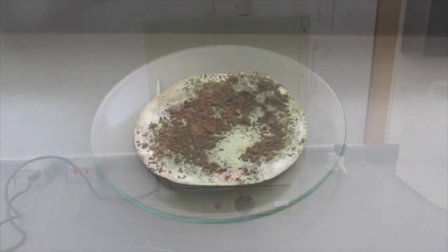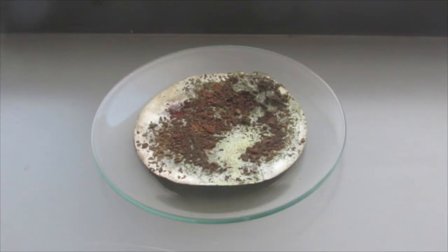When it's all dry, you can weigh your copper and get a final yield. Mine turned out to be about 75%. You can see a little bit of green on the copper present. That's from the copper oxidizing in the air, forming copper oxide, much like you would see on the Statue of Liberty, which was originally a copper statue.